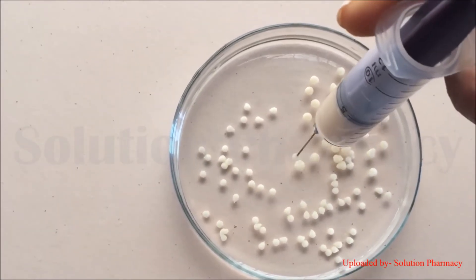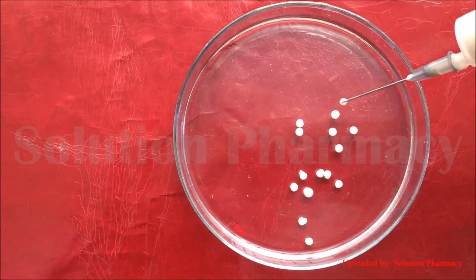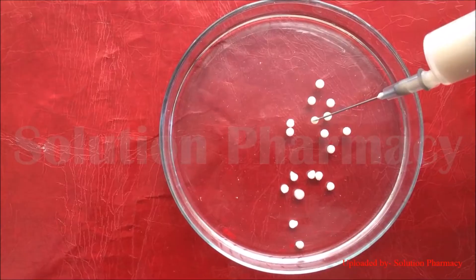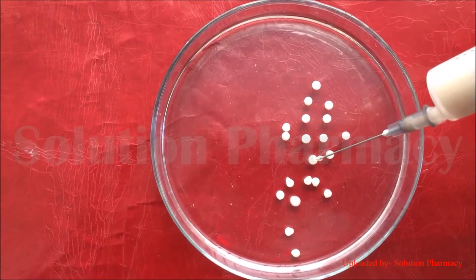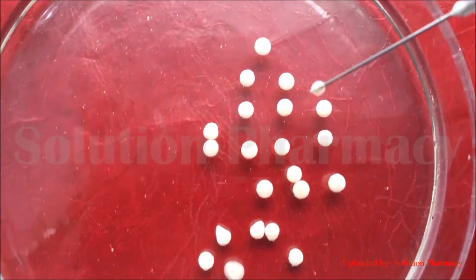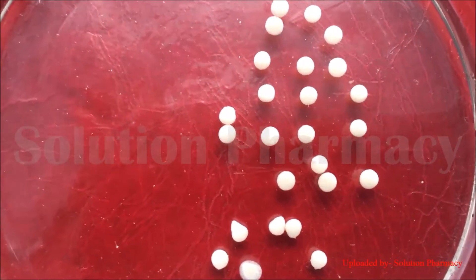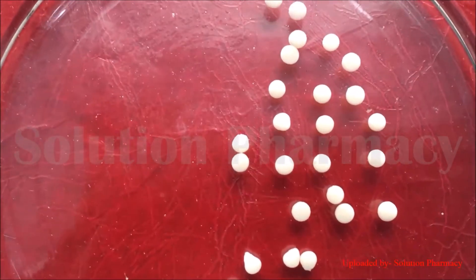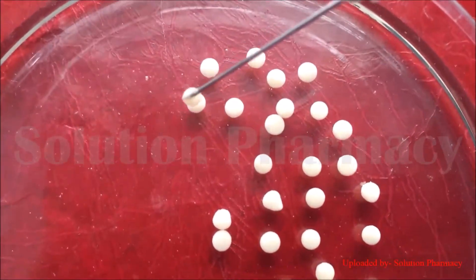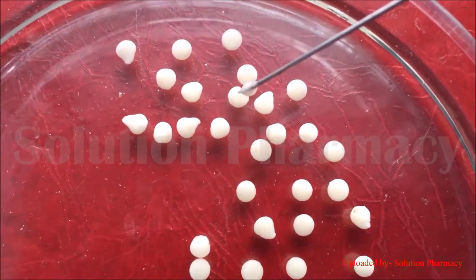You can clearly observe the beads of immobilized yeast cells against a white background, and then the same against a red background. You can clearly see how this spherical bead formation takes place when the drop of the sodium alginate and yeast mixture falls into the calcium chloride solution in the petri dish, immobilizing the yeast inside the calcium alginate matrix.